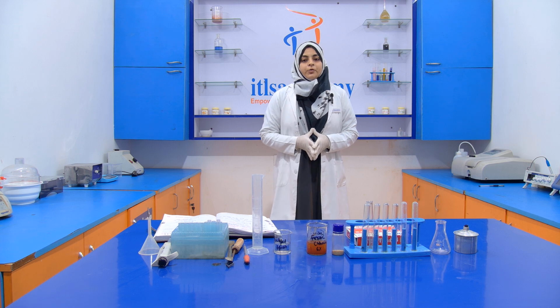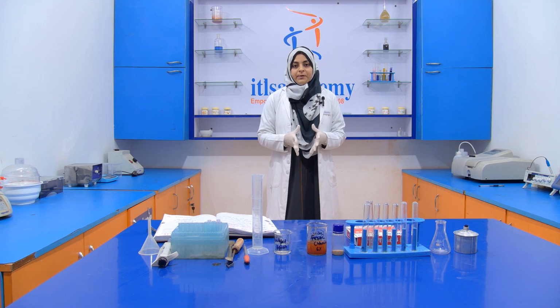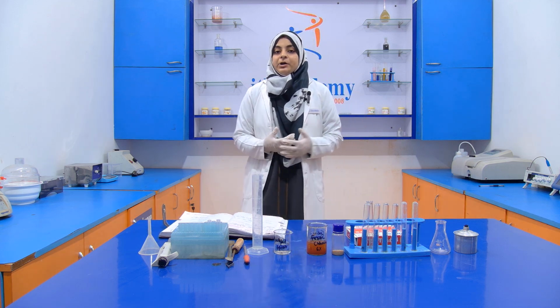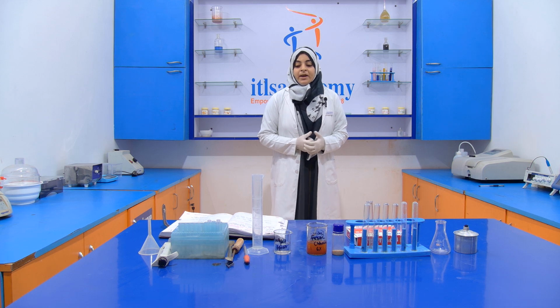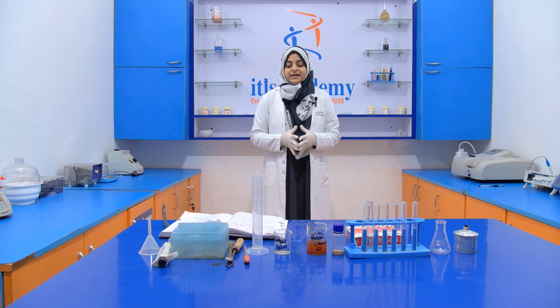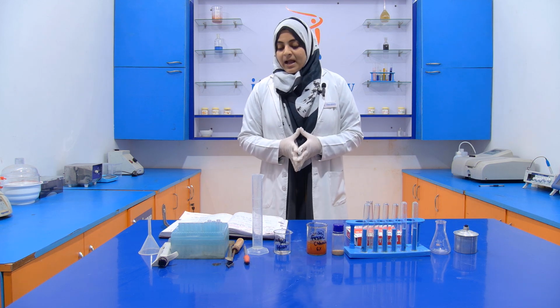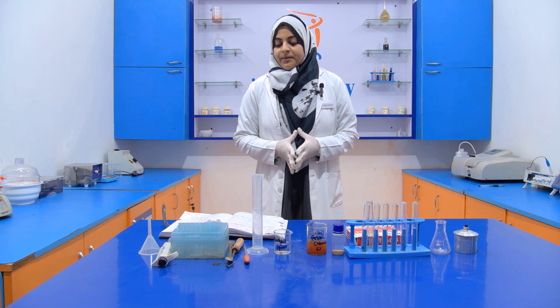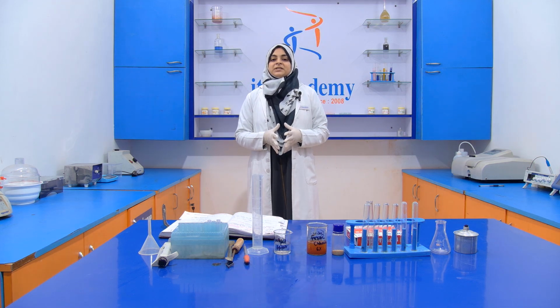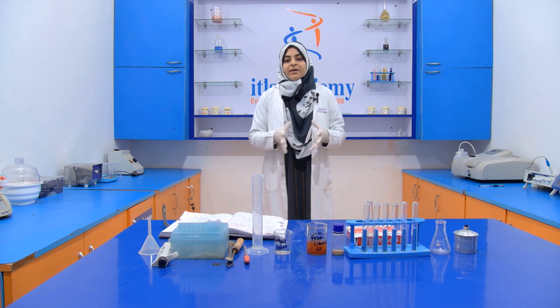Today we are going to discuss another experiment in the series of adulteration, and here we are going to discuss the adulteration in spices. The experiment that we are going to perform is the detection of foreign resin in Asafoetida. Our sample is Asafoetida, and the adulterant that we are going to discuss is foreign resins.